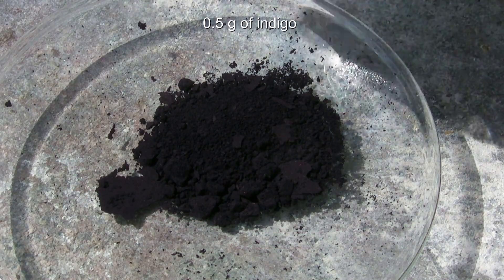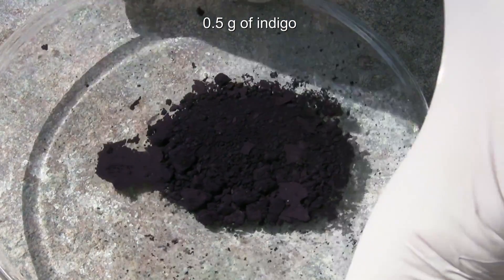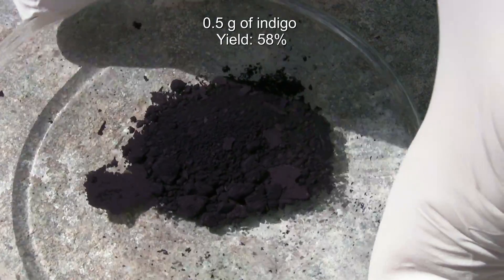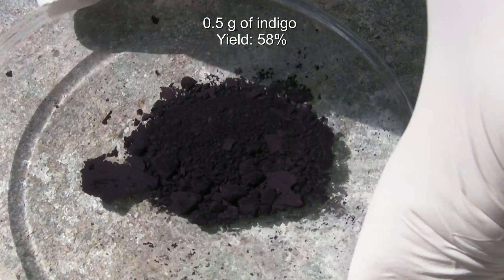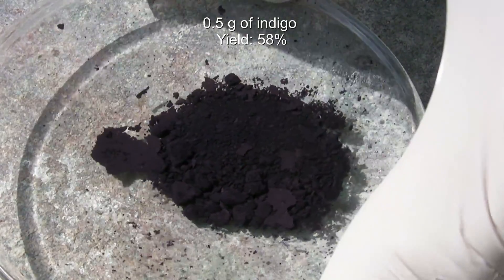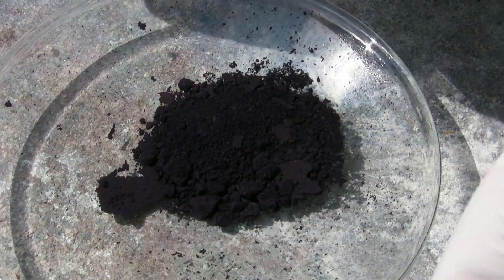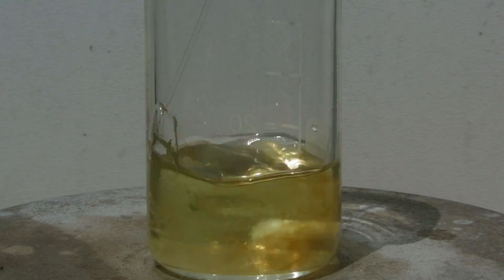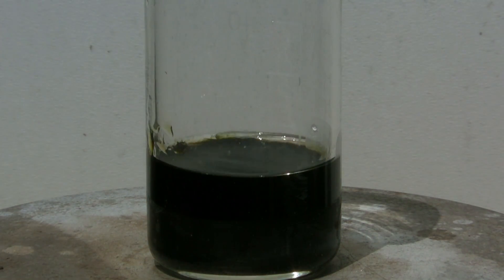0.5g of indigo were obtained, which corresponds to a yield of 58%. This was the synthesis of indigo. I hope you enjoyed — please rate and comment.